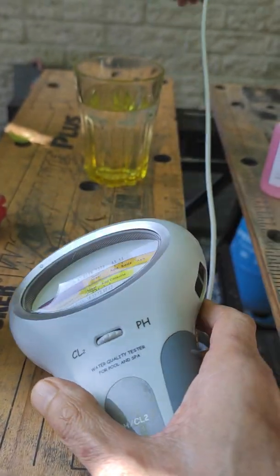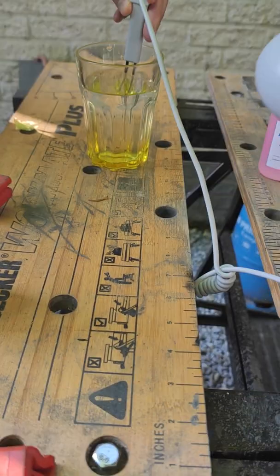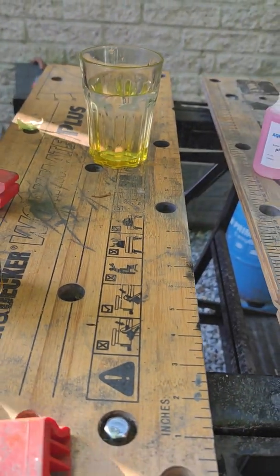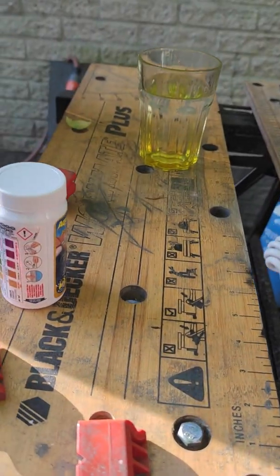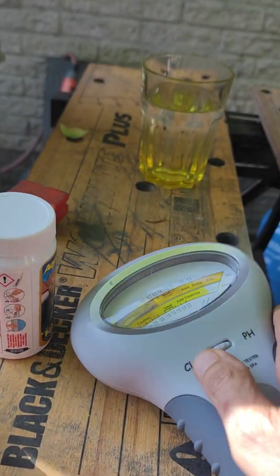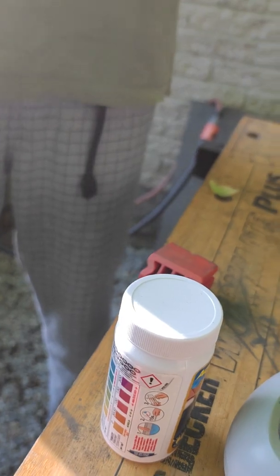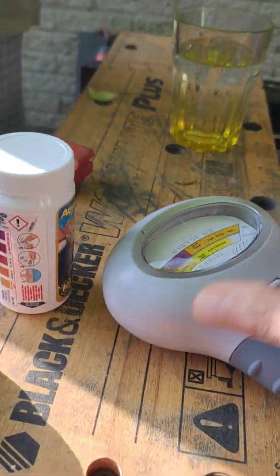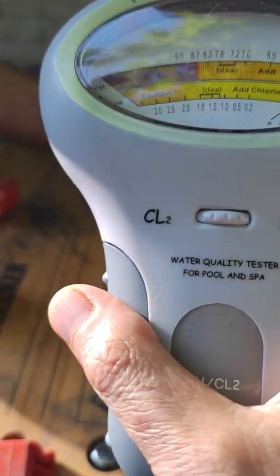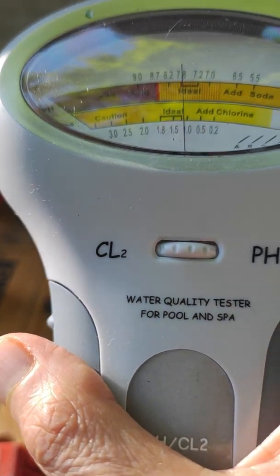Now put it in pH. Put it in this, but wipe it first, wipe it out. Put it in pH. That's good, that's enough.